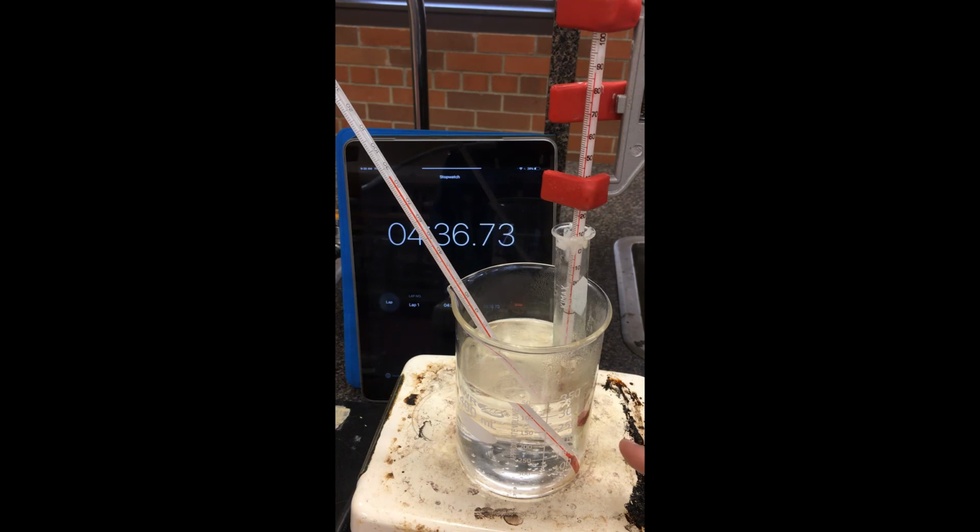Definitely we can tell that the stearic acid here has been liquefied in the test tube. I have the two thermometers. This thermometer here is sampling the temperature of stearic acid. My hot water bath right now has been a pretty constant 85, 86 degrees or so, which is why it's very hard for us to get even hotter than that. But fortunately for us, it's already been liquefied. I do want you to plot that temperature versus time. So temperature on the vertical, time on the horizontal, and then hopefully where the temperature steadies out would correspond to the melting point for this chemical. Thanks, guys.